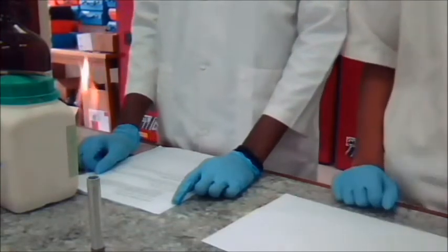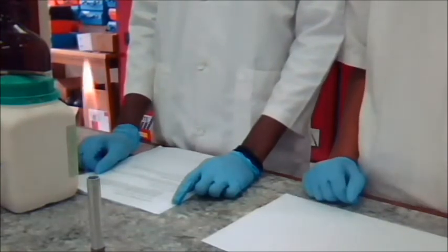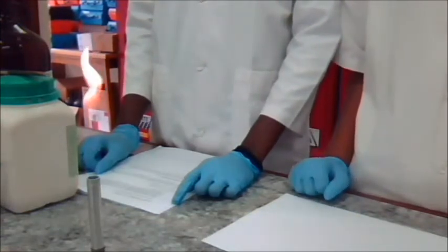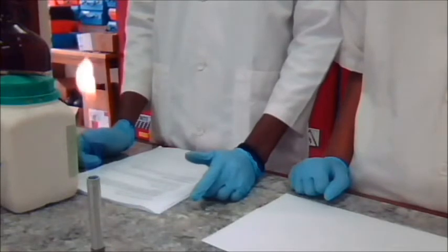If alcohol was the solvent, the solution should not be allowed to stand for more than 5 minutes because oxidation of the alcohol will begin slowly. Record your observations.